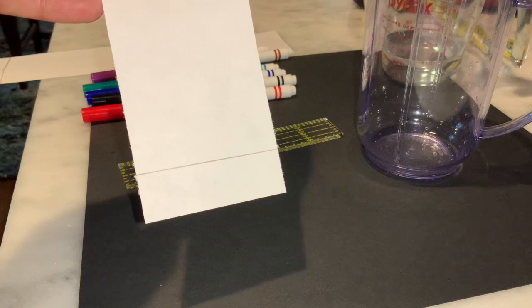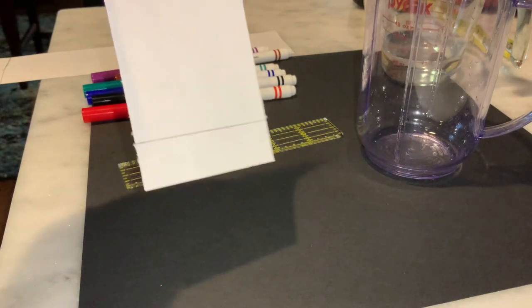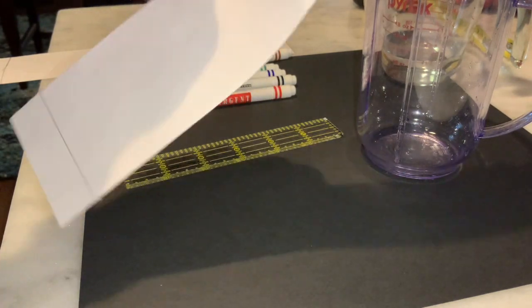Today our solvent that we're going to use is water. So I've got my line placed, what I need to do is place my samples on it.